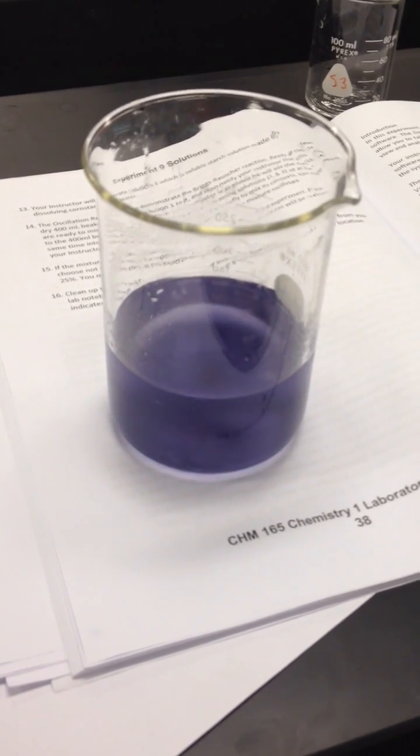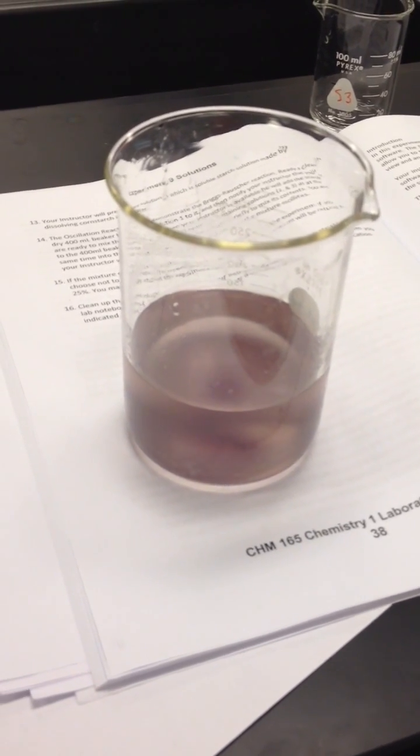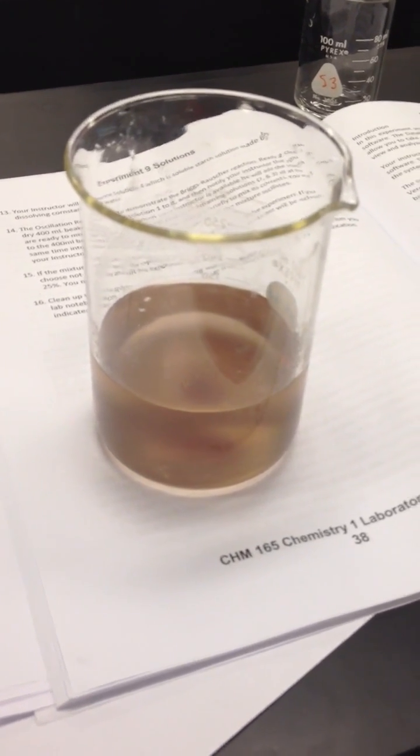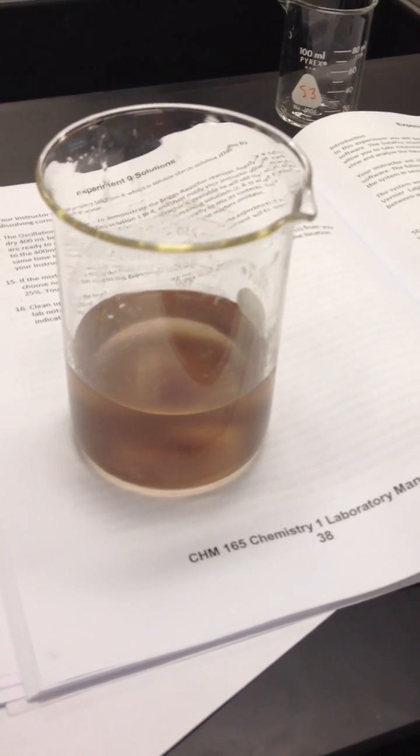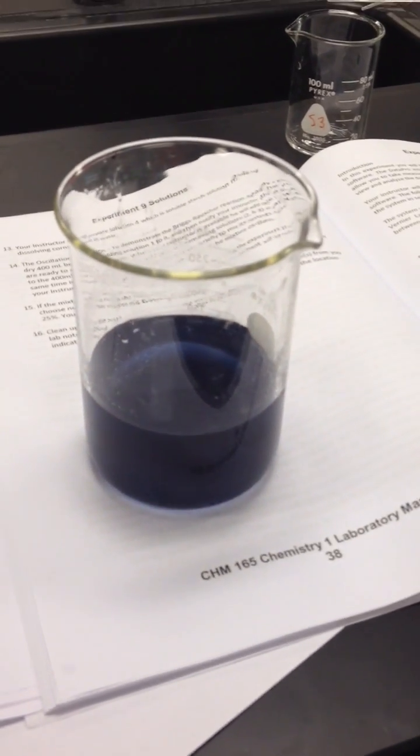So I want you guys to observe it for a few minutes and see, do you notice the difference in the rate of oscillation between the two different colors? Do you notice it because it didn't get quite as yellow that time? It stayed a little darker, so eventually it will end.